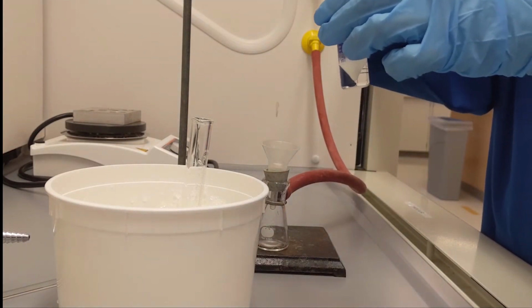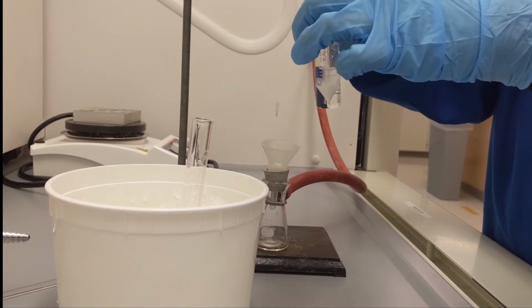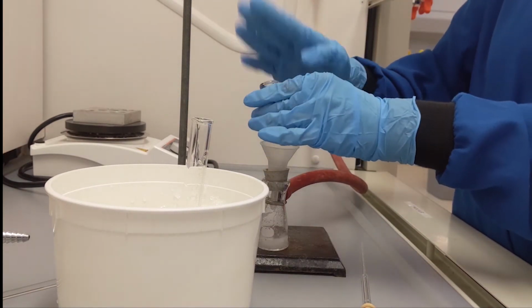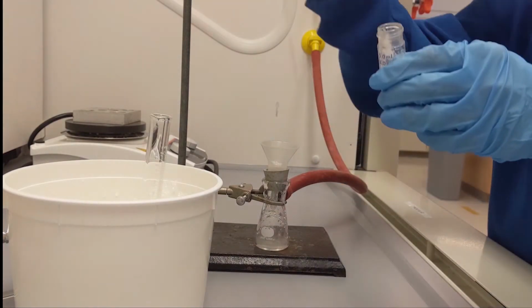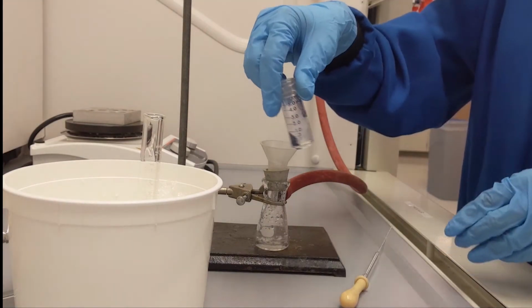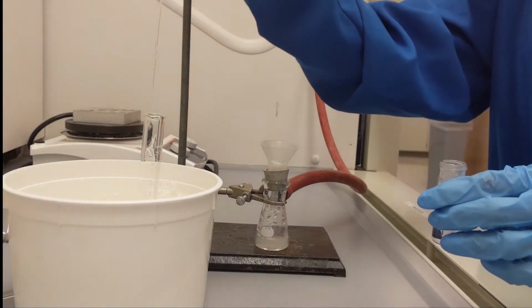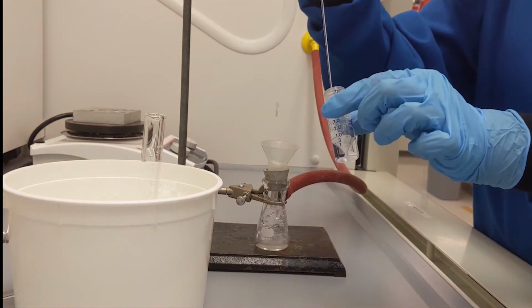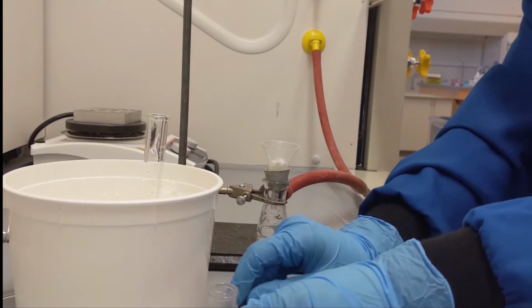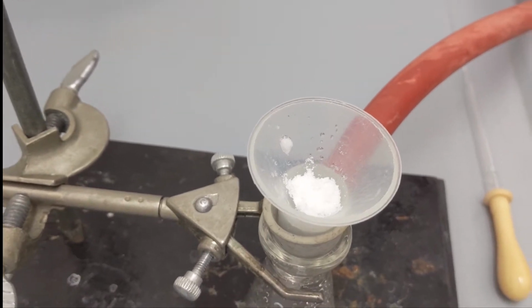You may want to wash your conical vial with ice-cold water a few times, with an extra of 1 milliliter ice-cold water once or twice to collect all the crystals remaining in the conical vial. After you have collected all the crystals in the conical vial, you will proceed to wash the crystals on the Hirsch funnel with ice-cold water a few times. Use 0.5 milliliters of portions. Let air run through your filtered solid for 5 to 10 minutes to dry it properly.